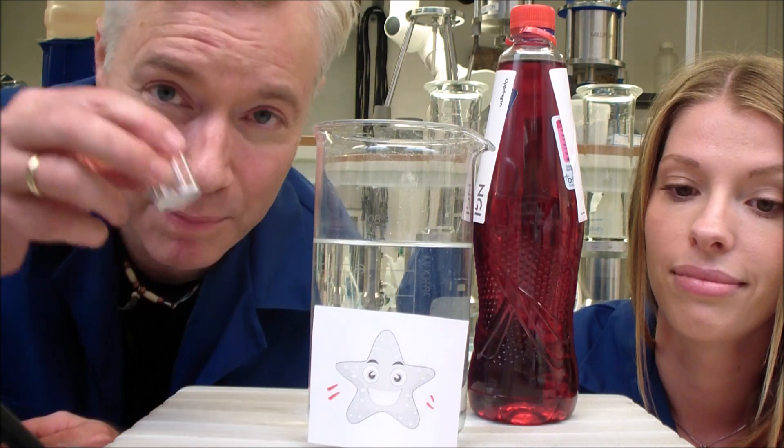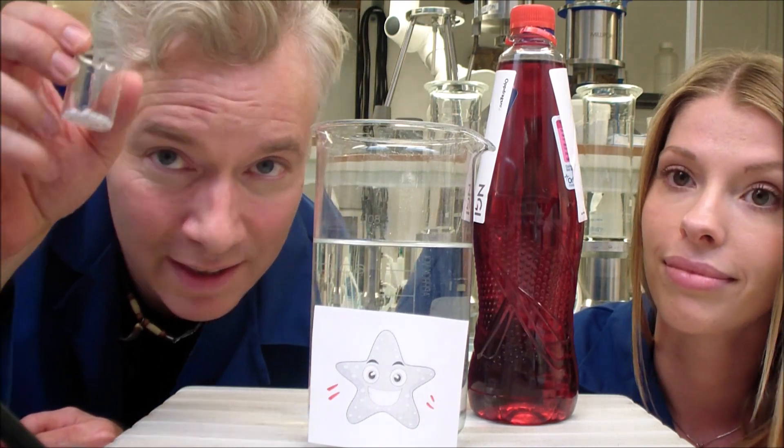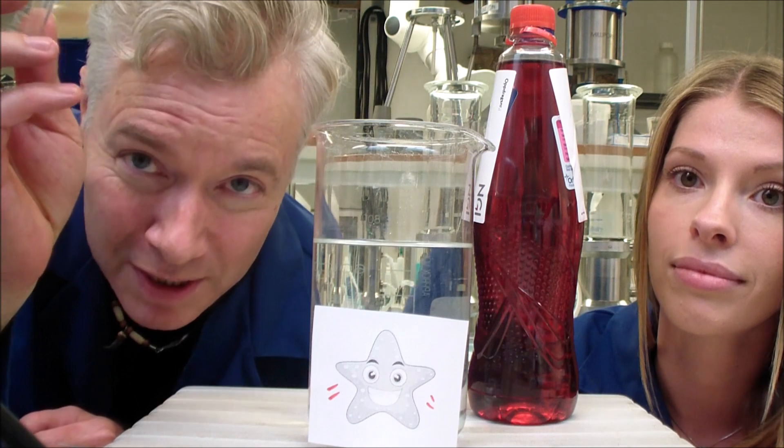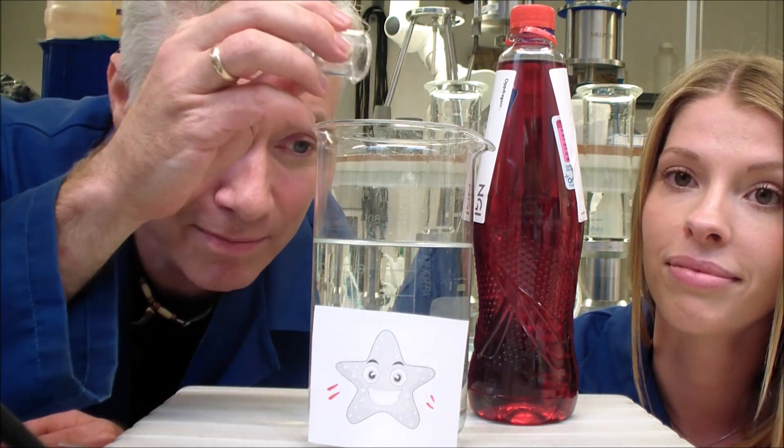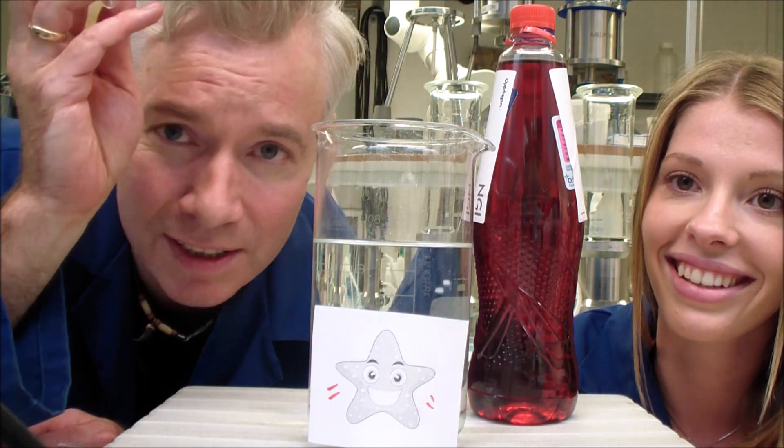Now, I have some examples of PET plastic right here. These are exactly the same as in a bottle, and I'm going to pollute, unfortunately, our little Starsky the Starfish. Oh, they just sink.